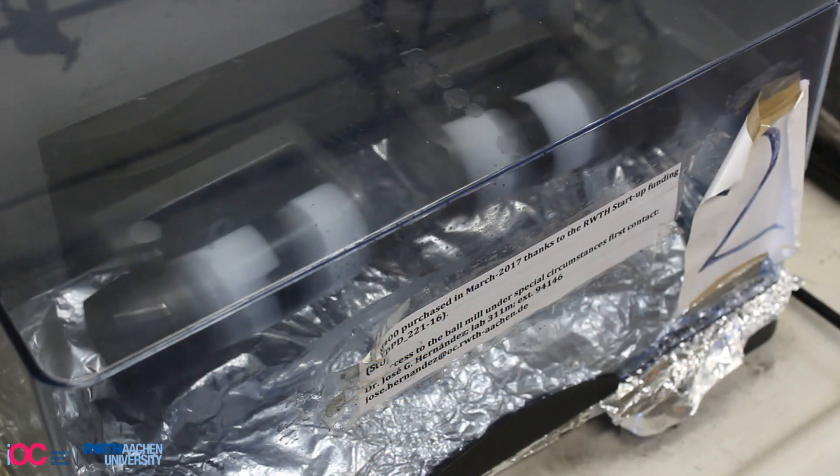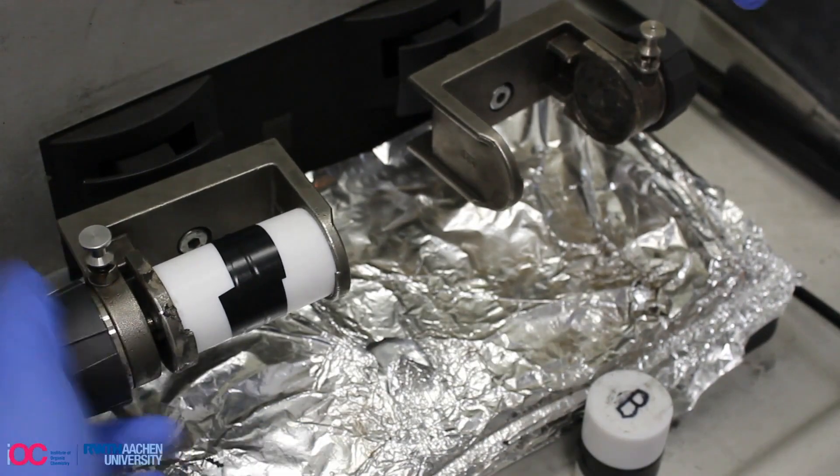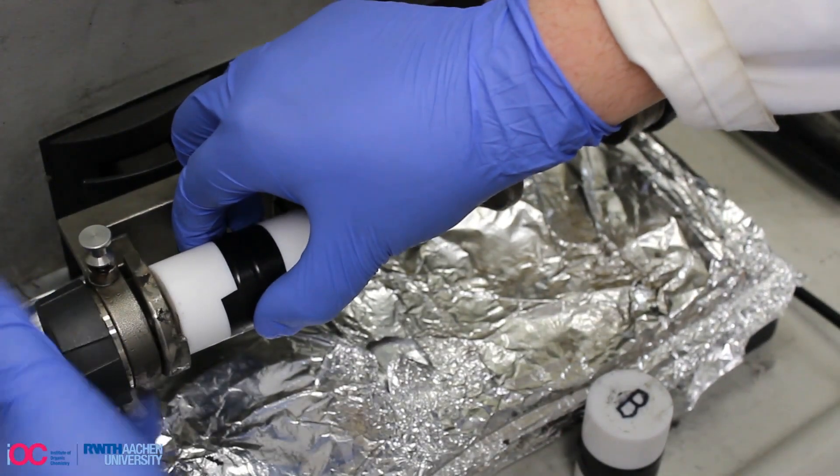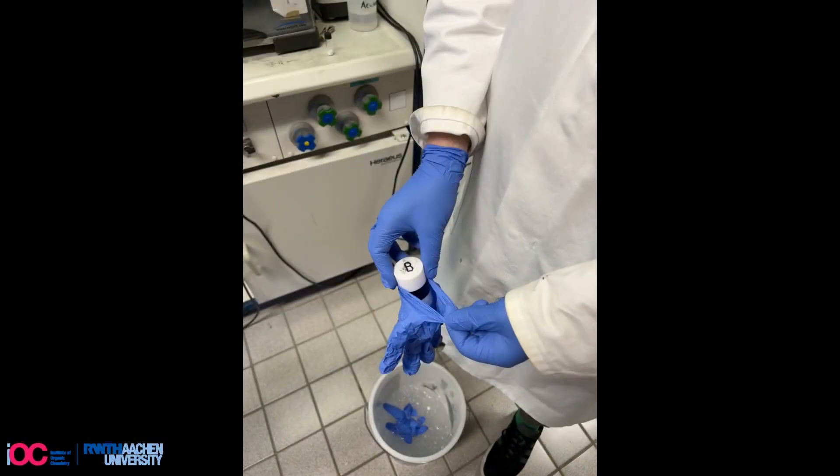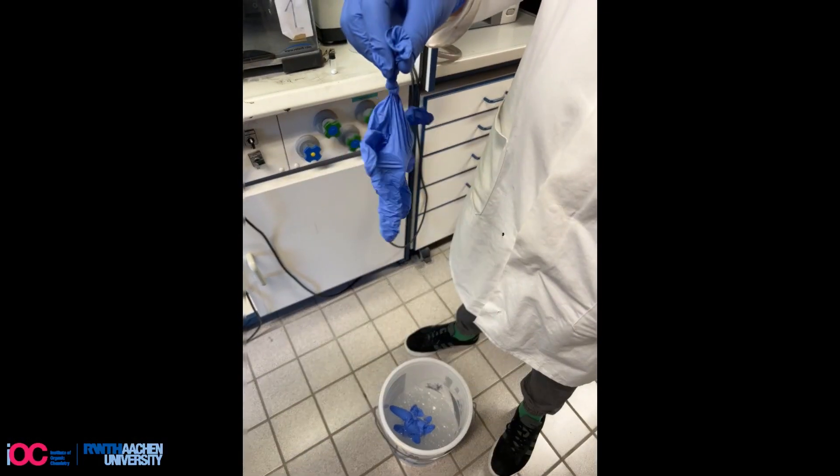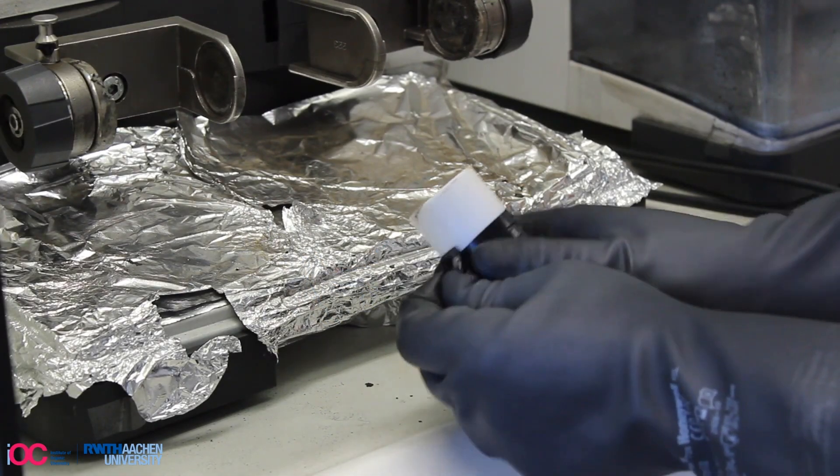After finishing the milling process, the milling jar is carefully removed and subsequently covered by a nitrile glove to cool the reaction mixture in an ice bath prior to opening. This was crucial as we improved our reaction yield since sulfonyl fluorides are often characterized by high volatility.